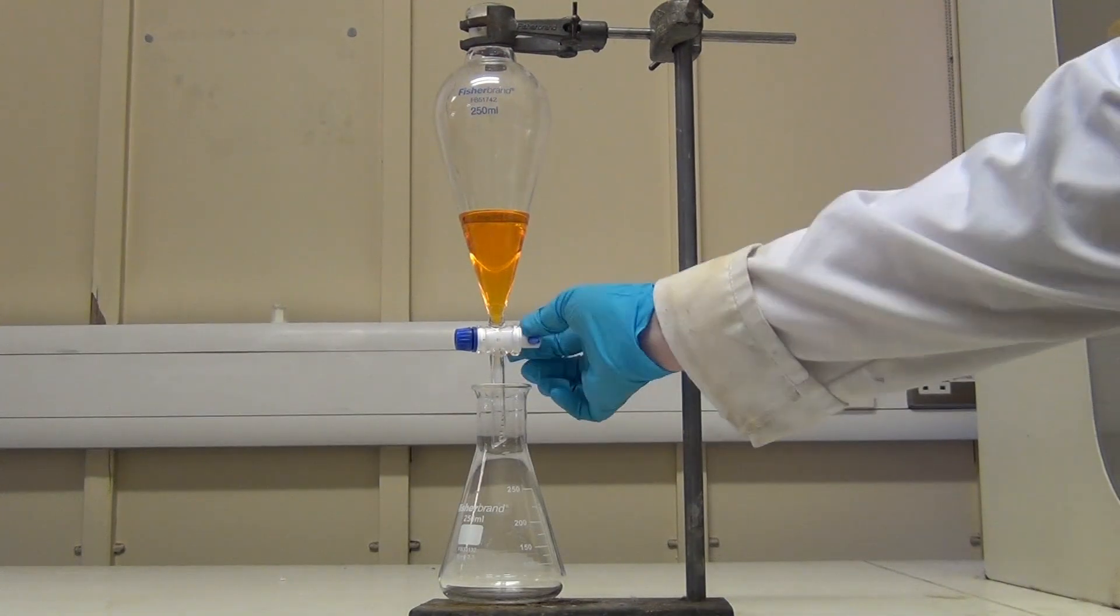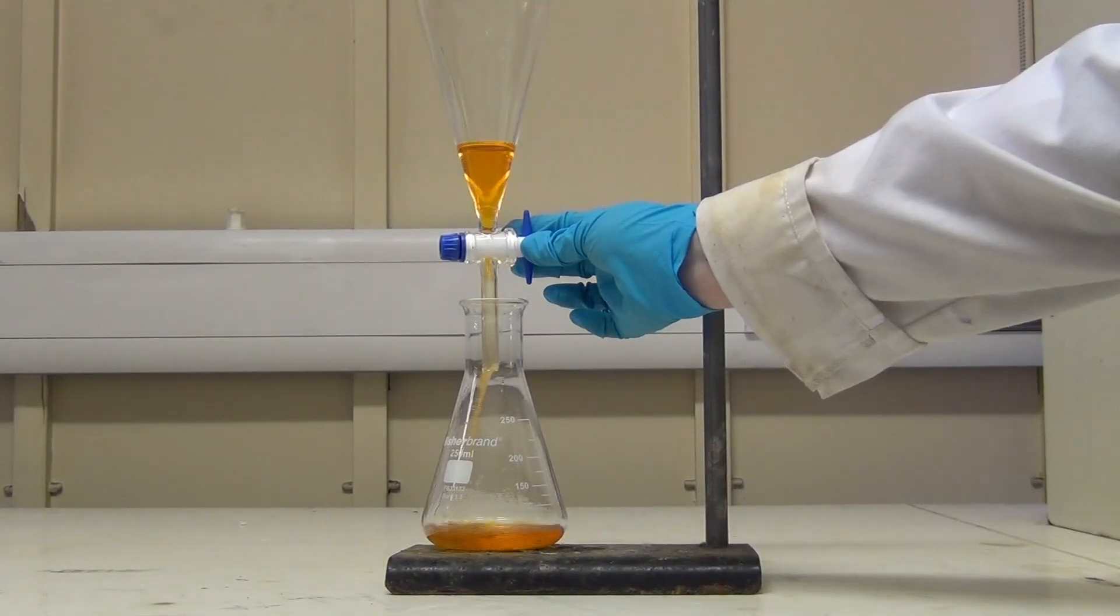Put this conical flask to one side and collect the remaining layer into a new, clean, conical flask.